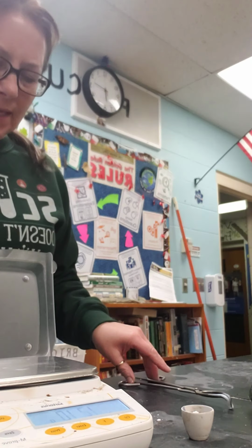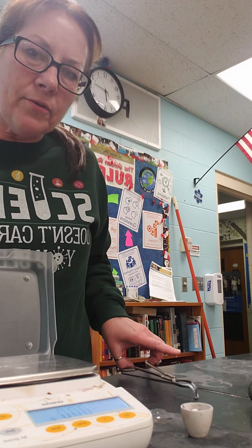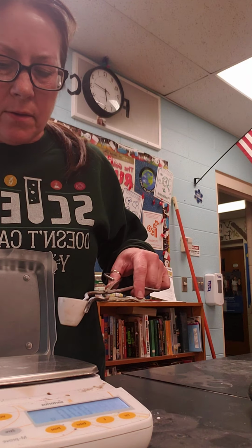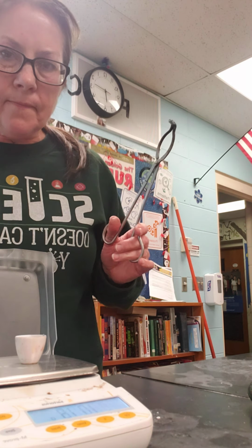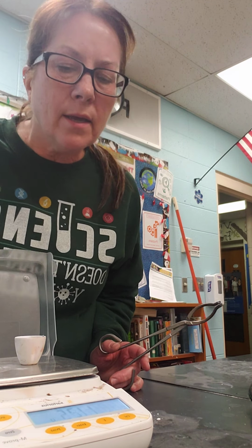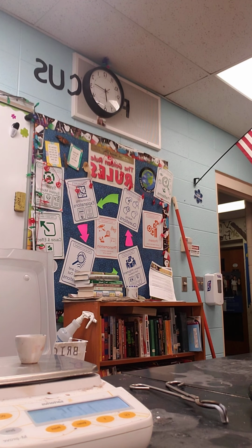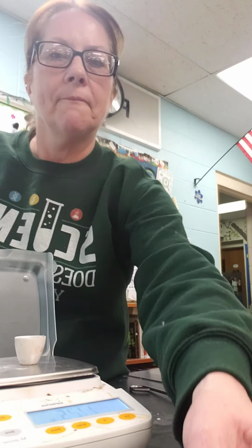All right, now let me get the mass of my crucible. Okay, now this one is 11.25. Okay, so there you go.